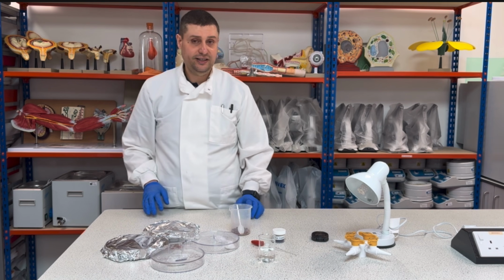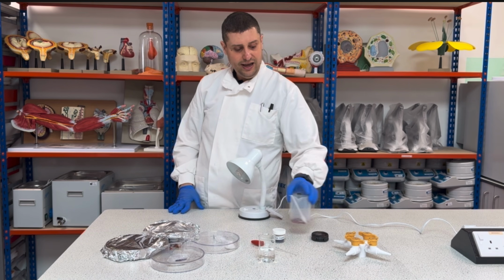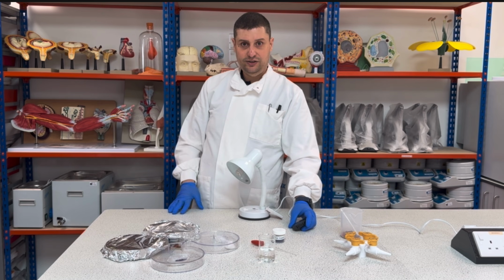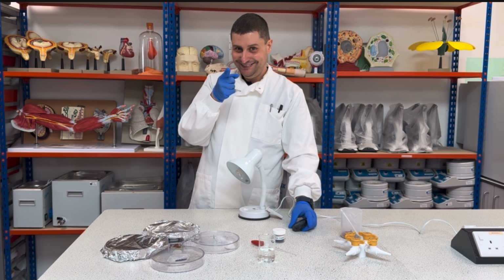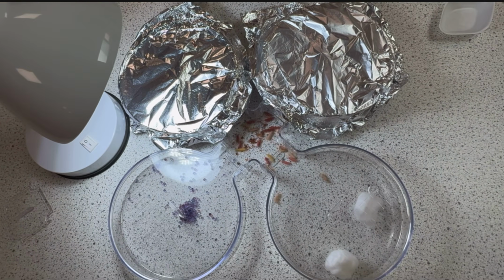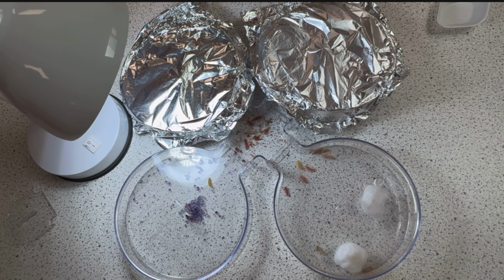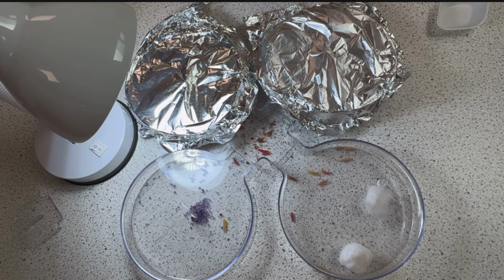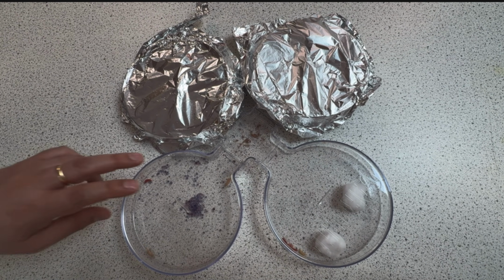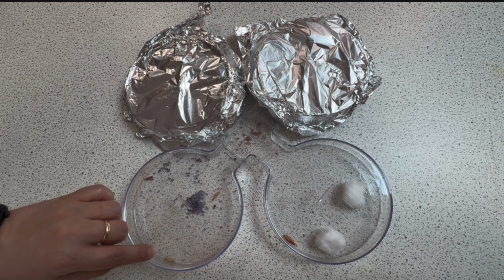So after it's placed here, I will put my light on the top and I will keep it for about 10 minutes. So come close to see. After 10 minutes, we can see that in this area here, I have 1, 2, 3.